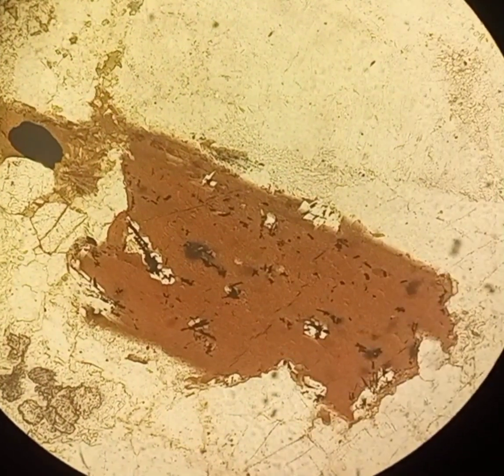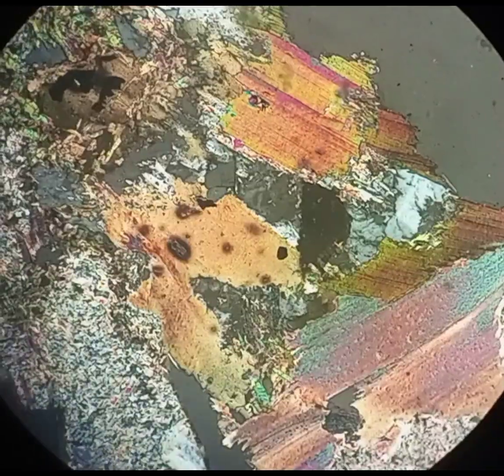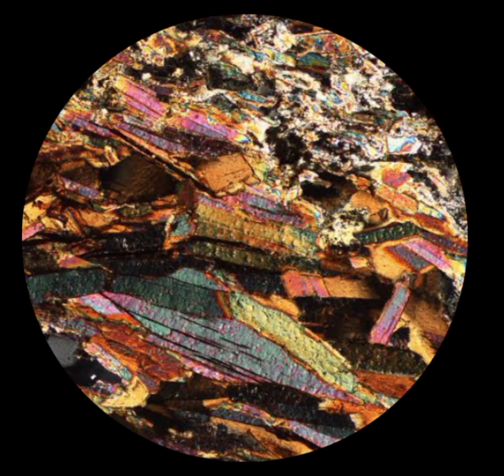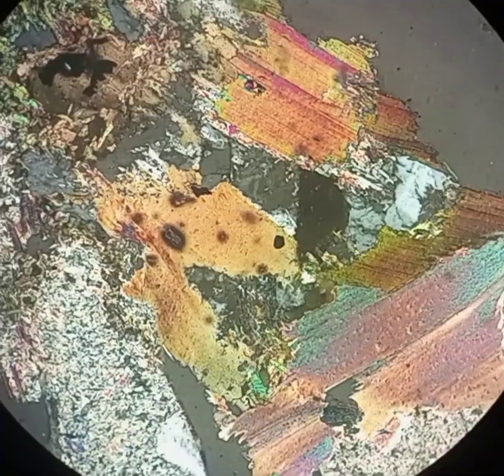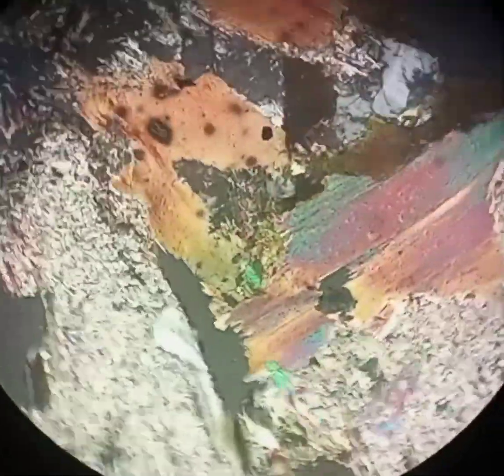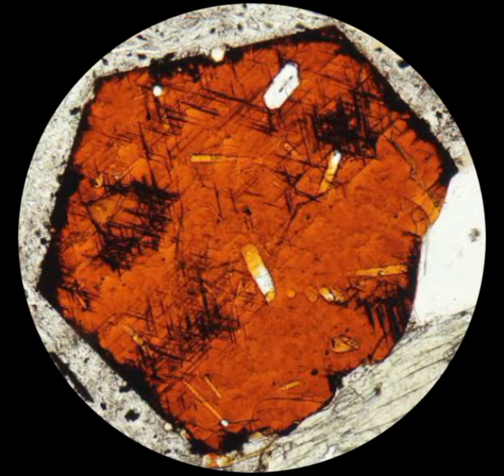Crystal habit and crystal form are very important for the identification of biotite. Biotite is found as tabular or long flaky thin sheets, which may sometimes be bent. It also sometimes gives a pseudo-hexagonal appearance.